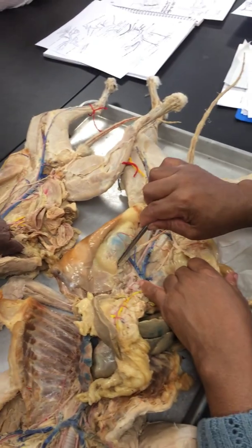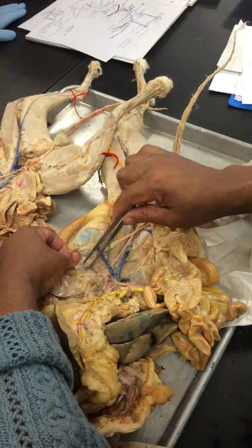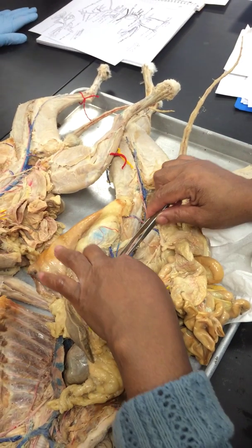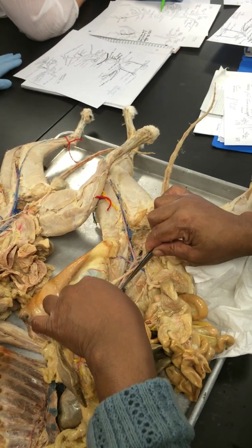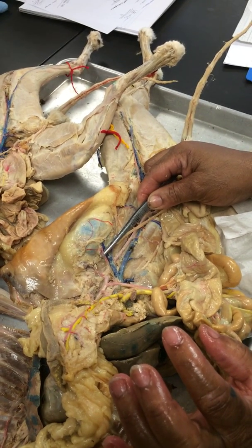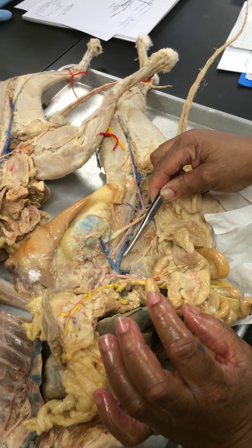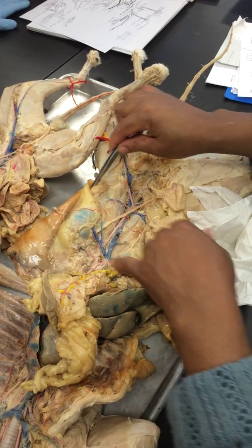Come on down. Well, there's this little one. Usually we don't do it because it gets torn off. This little red one, that's the adrenolumbar, so you can ignore it. Come on down. And the next one that you're really responsible for is this one, going into the kidney. That's the renal. This is the left renal, and here's the right renal over here. And then you're going to come on down.